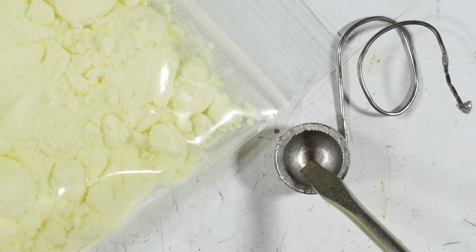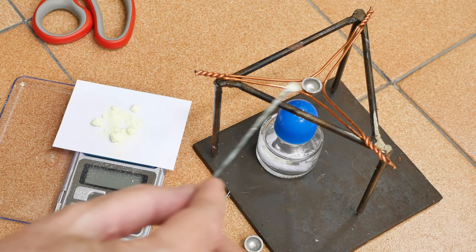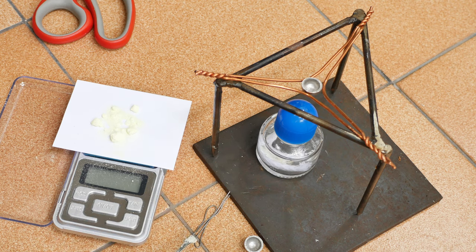Okay, well, that's it. I guess the next thing to do is just go do it. This is my heating rig. This is the little metal cup I'm going to use. As you can see, this is 1 gram of lead, so I'm not going to use 10 grams of lead as in my earlier calculations.